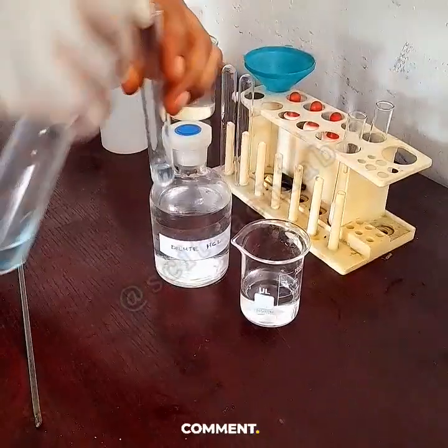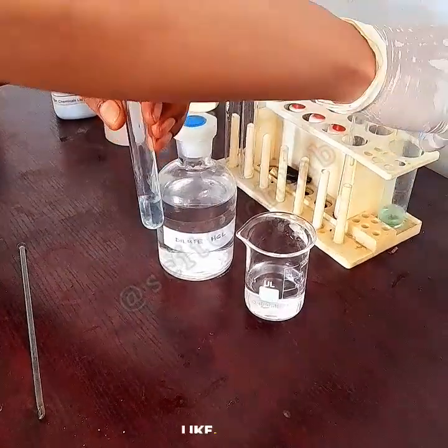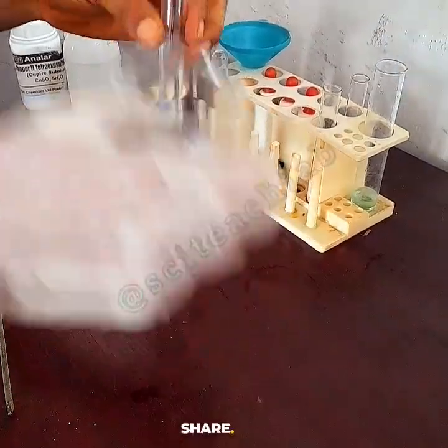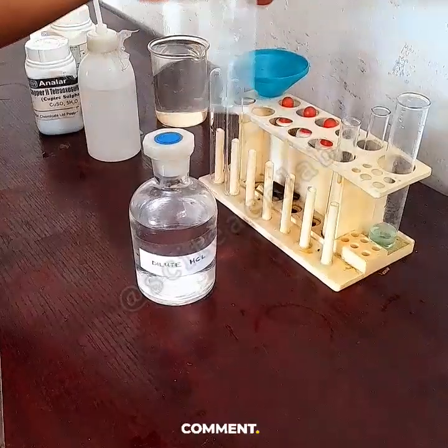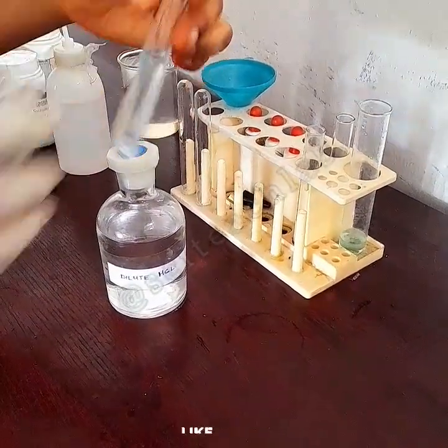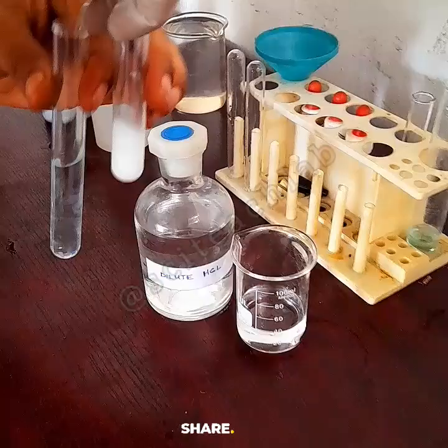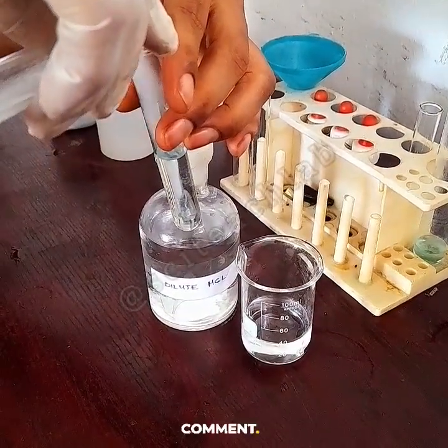Even if you want to use hydrochloric acid first, you have the same solution. Say I use hydrochloric acid first, not barium chloride first. I pour in hydrochloric acid in excess, so that it prepares the solution for whatever is going to come in. If it were able to dissolve whatever is coming in, it should be dissolving it as it comes in. So let's see what will happen.